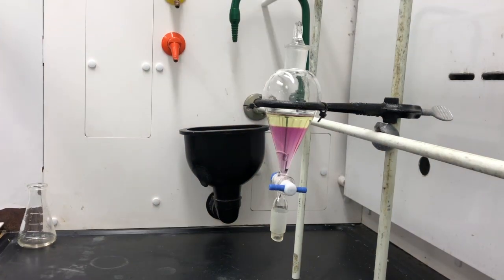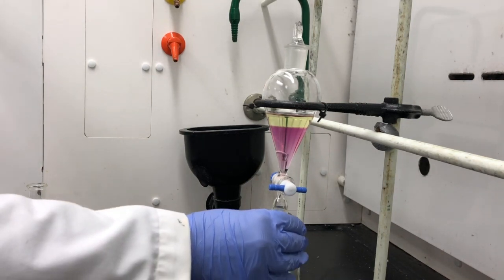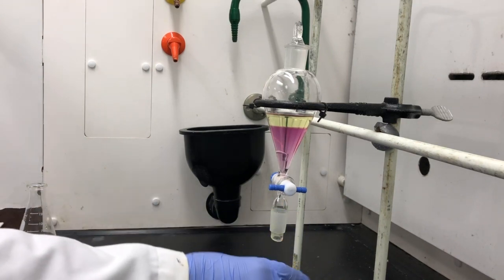So when both layers have separated, give it a minute or so, and make sure you open it to dispense the layer of interest. Again, if we're not sure, we could always add a drop of water. And then have your flask right in here.